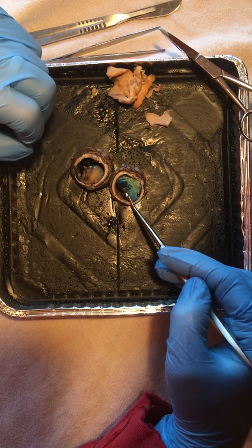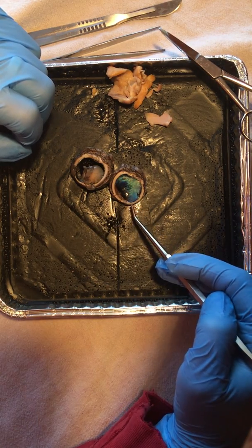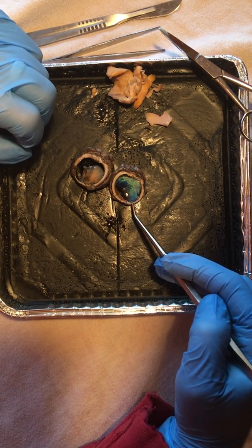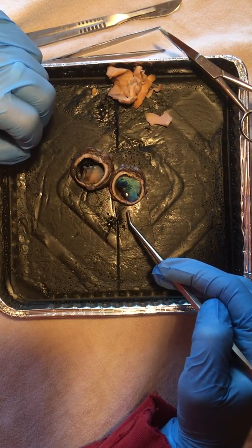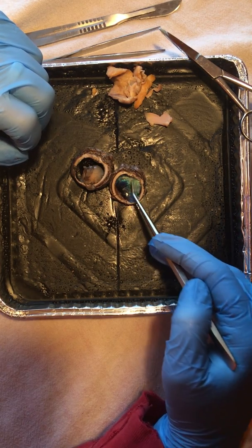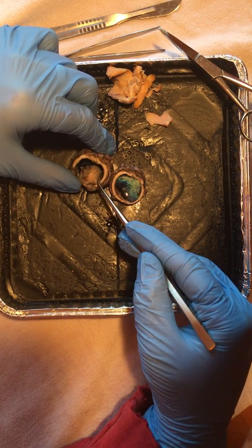And something that's unique to mammals, in particular deer and sheep and cats as well, is this iridescent coloring, this beautiful blue and green that humans do not have. This particular part of the choroid tissue helps in night vision by reflecting any kind of available light back into the retina. So this, again, is not present in humans, but in sheep as well as other mammals. So that's a really unique structure here.